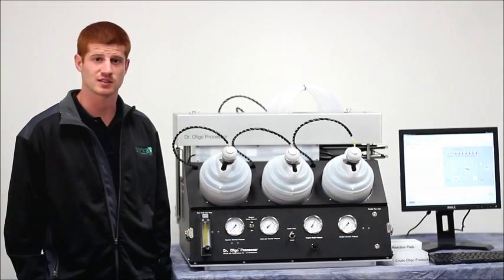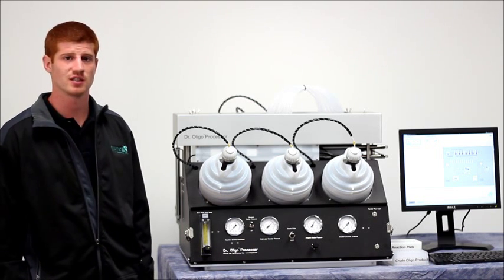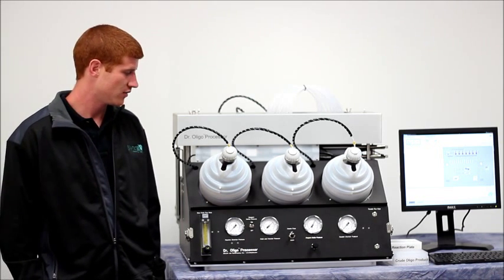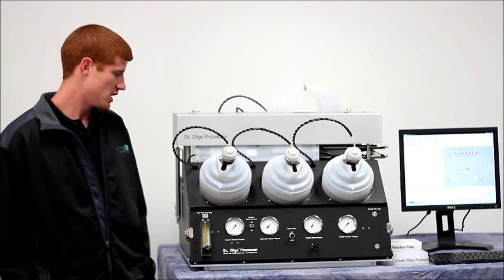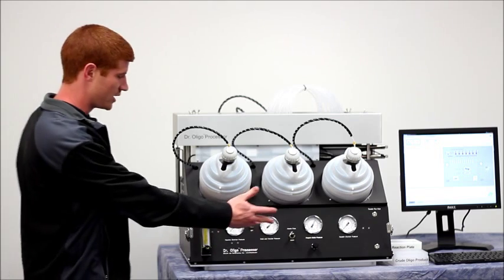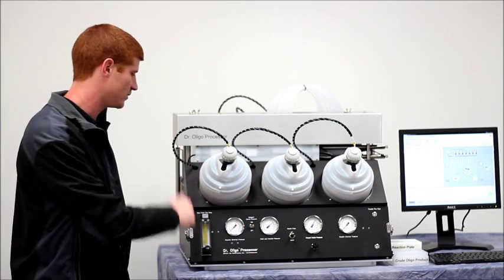So this is the Dr. Oligo Processor. I'm going to give you an overview of the instrument to give you a better understanding of how everything works. First, let's start by examining the components of the instrument. As you can see, you have four regulators on the front panel of the instrument that display various pressures of the instrument.